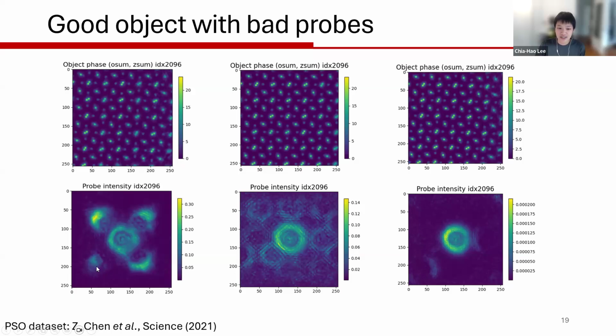You can see the real space probe being duplicated at all these random positions. And this one nicely shows you an example of object probe intermixing, where these probes are duplicated with object spatial frequencies, and you can see there's pretty much just a duplication. Translation in real space is just a phase shift in reciprocal space, so you actually get the exact same diffraction pattern, or at least very similar given the experimental parameters.